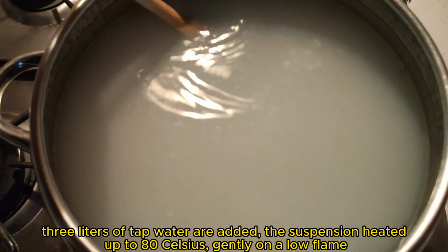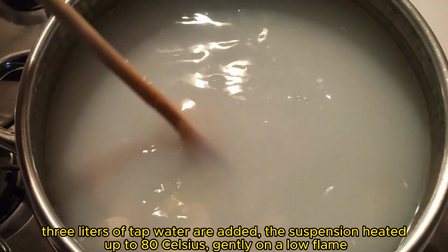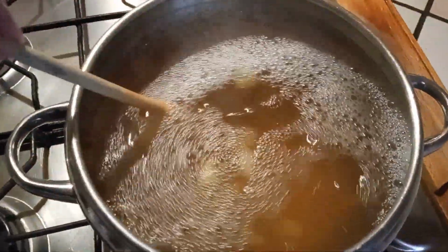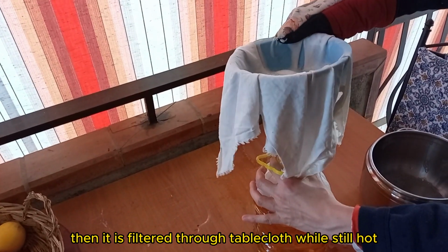3 liters of tap water are added. The suspension is heated up to 80 Celsius, gently on a low flame. Soap takes 2 hours to dissolve. Then it is filtered through tablecloth while still hot.